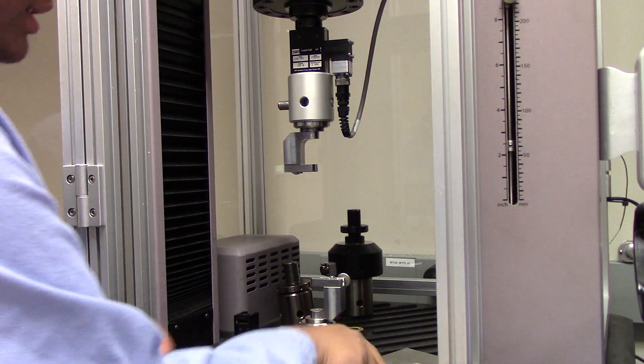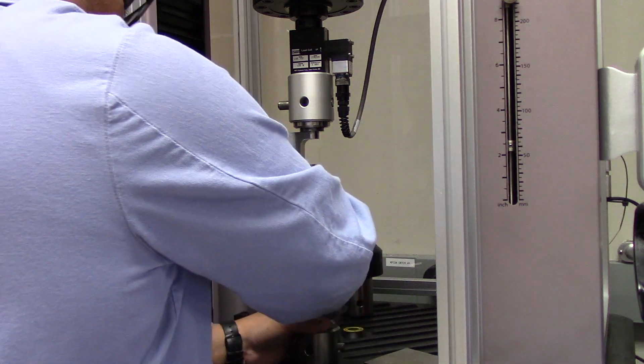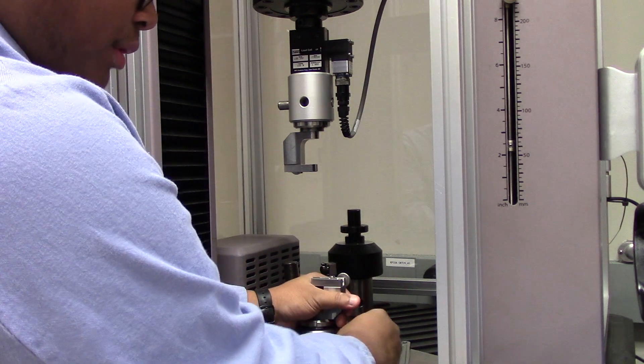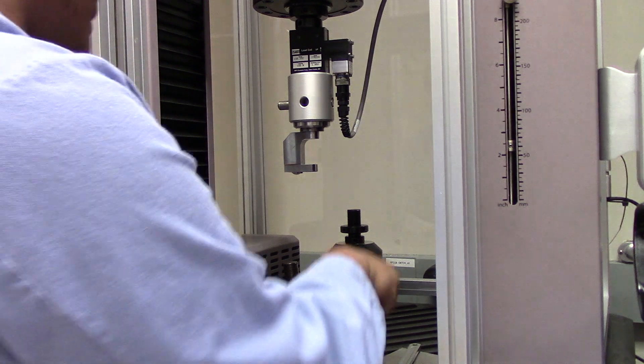Like with the high force component, remove the lower grip by rotating counter clockwise with the hook wrench. Once that's nice and loose, I'm going to remove the pin and the lower grip, and place them both into a safe location.